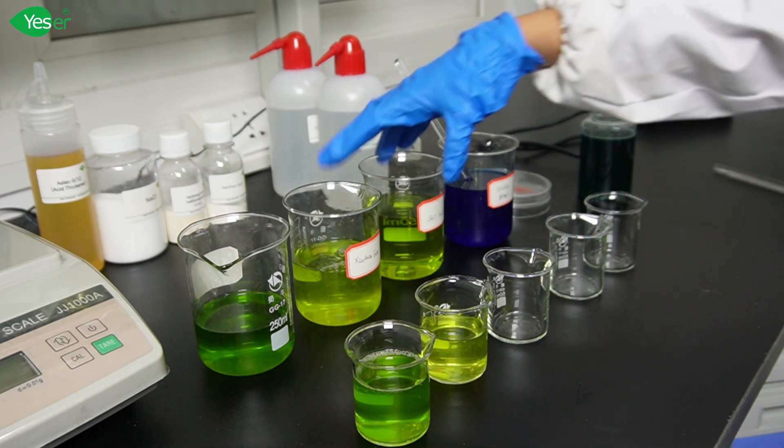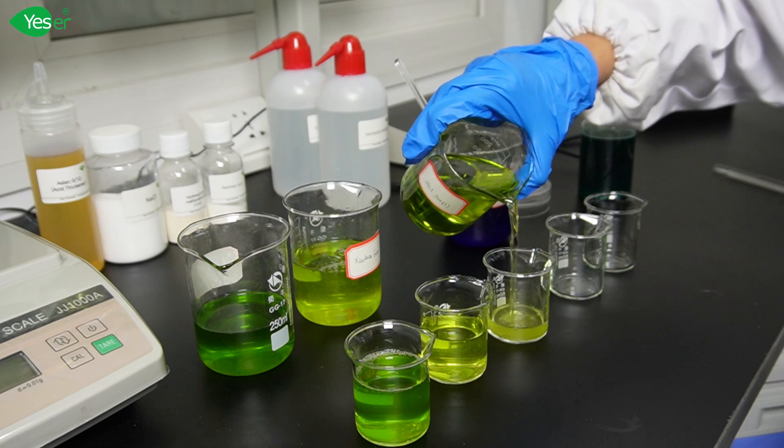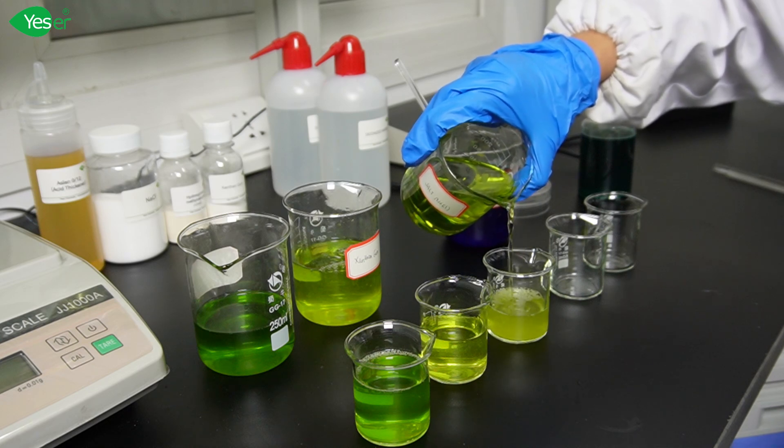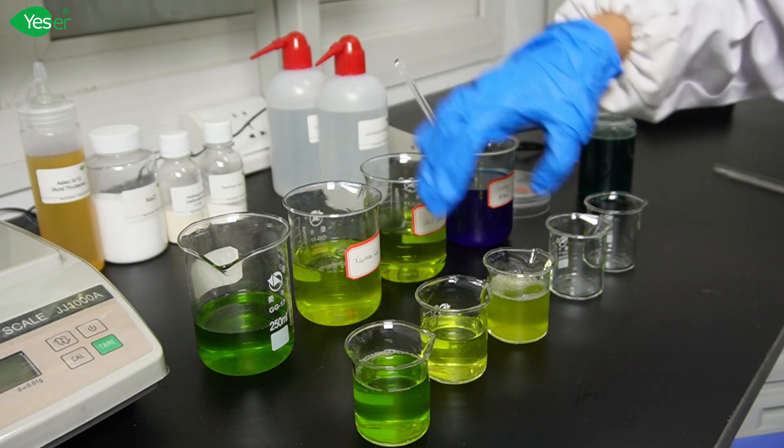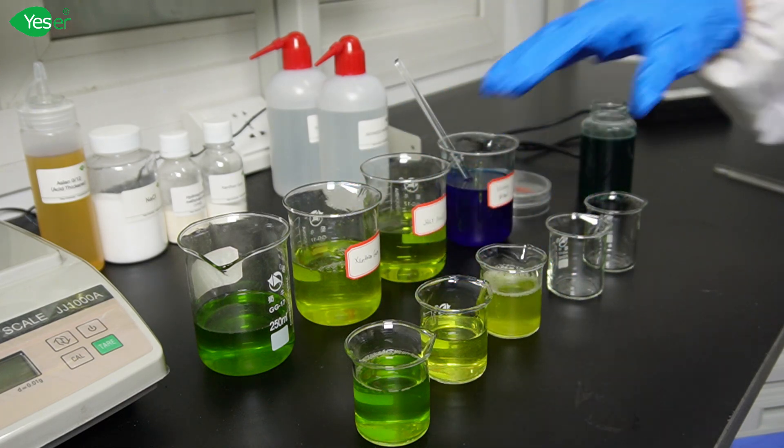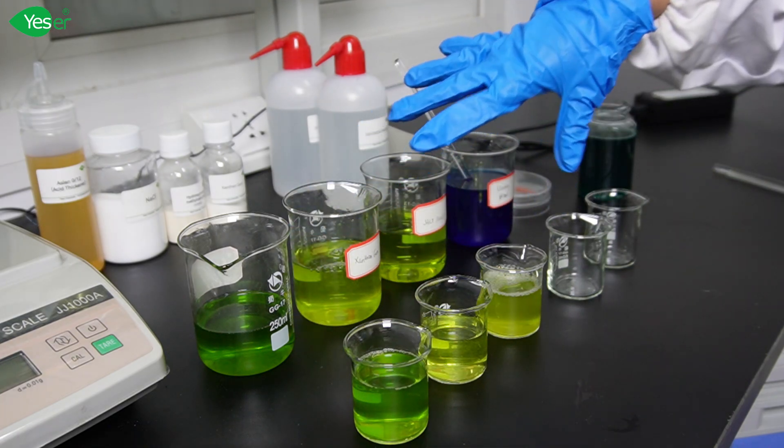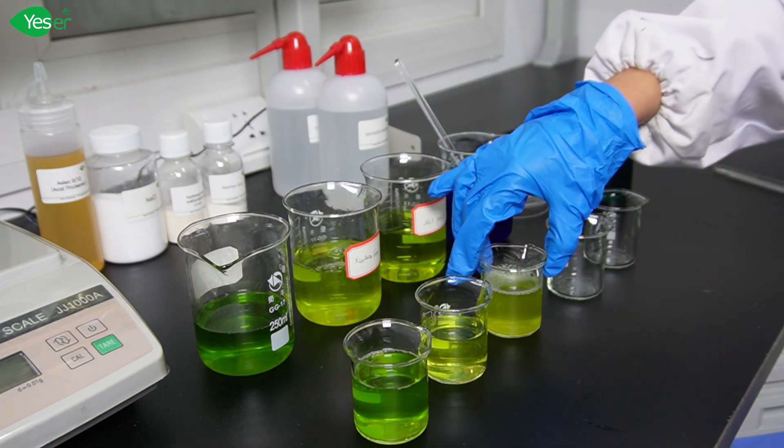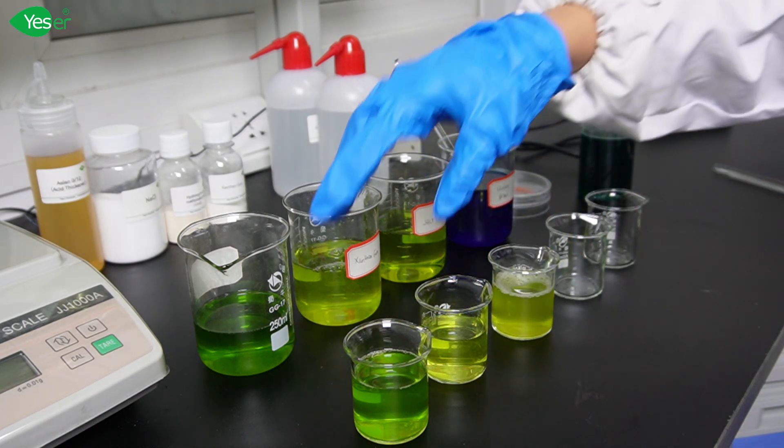Next is salt or NaCl thickener. As you can see, salt has a watery viscosity in our formula. This is because of the high concentration of hydrogen ions which competes with the sodium ions from the salt and the micelle interactions. This disrupts the ionic balance which is crucial for micelle thickening, thus preventing salt from effectively increasing the viscosity. Based on the results, these three common thickeners are not effective in increasing the viscosity of our strongly acidic formula.